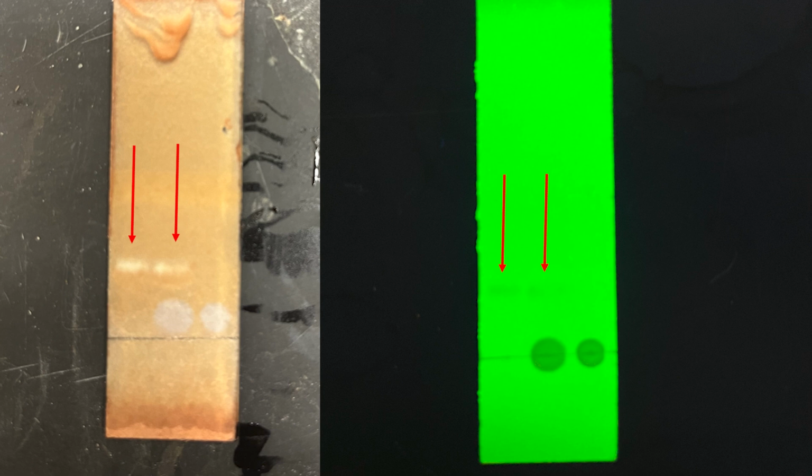Now make sure that you look at it with fluorescence before you spray it down, because once you've used some sort of colorimetric reagent, it's permanent, it's done, and you can only use one. You can't say, oh, I want to use iodoplatinate and then use Van Urk's and then use Dragendorff. Occasionally there are these very intricate sequences that can be piled onto each other, but in general assume that once you've sprayed it with something, it's done. That's the end of it.